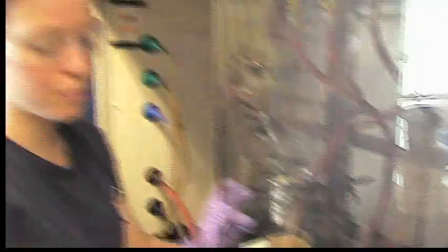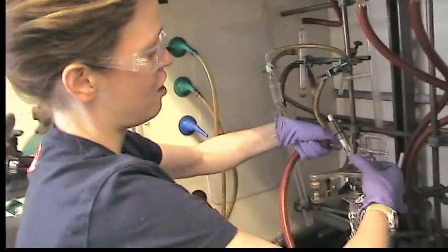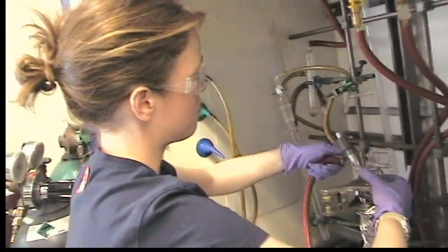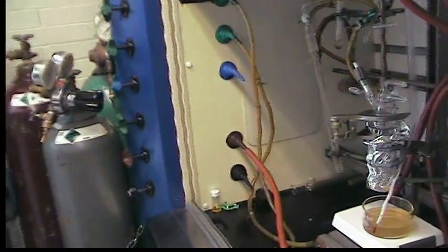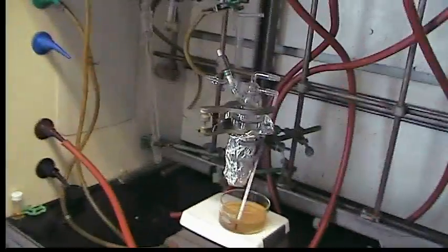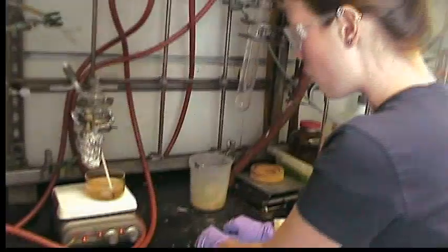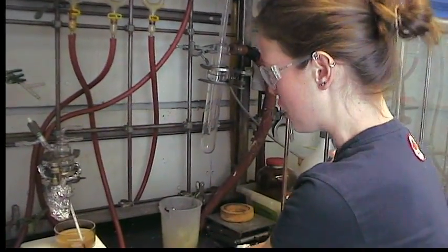I've been under vacuum for quite some time. How good is the vacuum, or how good does the vacuum need to be for this temperature? I don't think you need a vacuum that's that great. We tested our vacuum the other day, and it went down below one torr, so I would say below one torr is probably good enough.